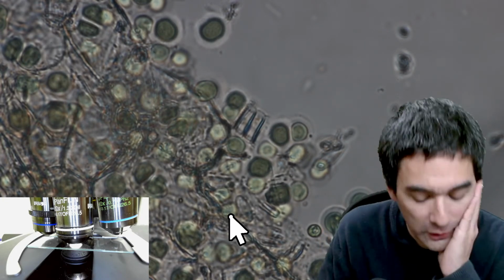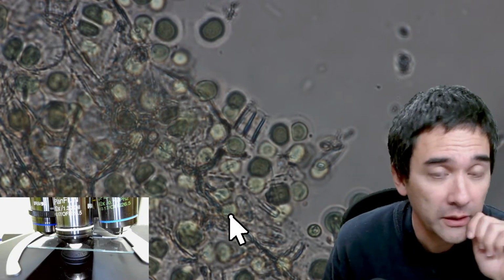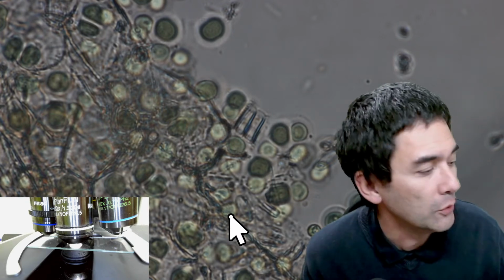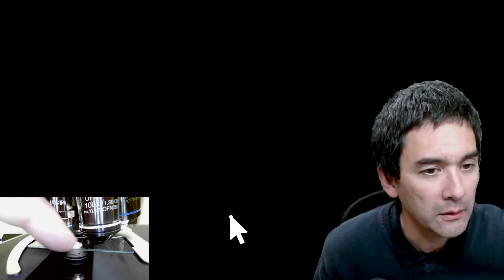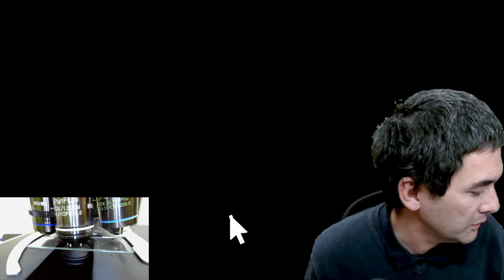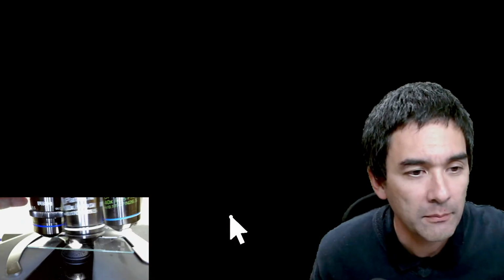But now I'm going to do the following. I'm going to add a drop of immersion oil and have a look at it again. So when adding immersion oil, if you do not have this focus lock lever, what you do is you carefully rotate it away. You apply a drop of immersion oil and then you rotate it back in. Just for your information, I've got a setting right now where it always automatically adjusts the brightness. So that's why. Yeah, this is basically the way that you normally would do it.